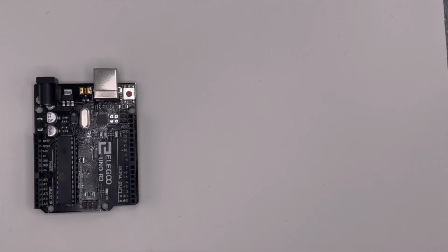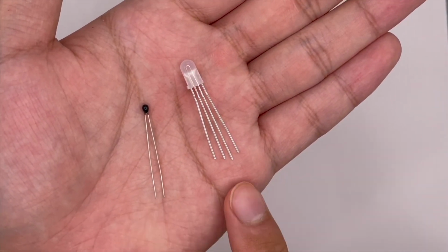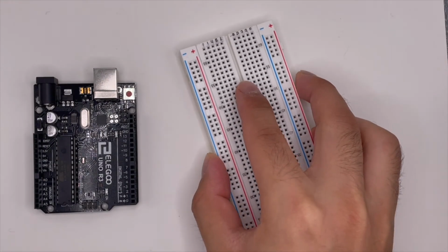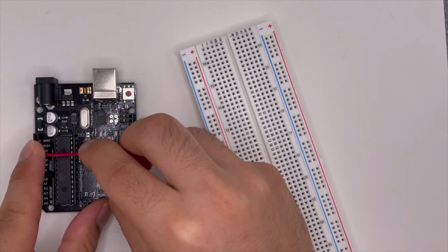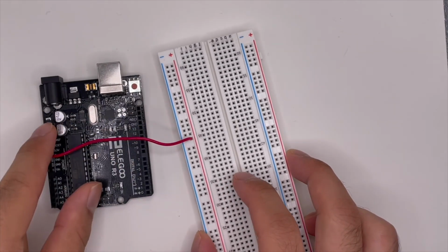For the hardware, we have two main components to connect to the Arduino, a temperature sensor and an RGB LED. To make things easier, we'll use a breadboard so we can connect wires to the Arduino and sensors without soldering. Let's begin by powering the breadboard. We will connect a wire from the 5-volt pin of the Arduino to the positive red bus line of the breadboard. So from here to the red bus line.